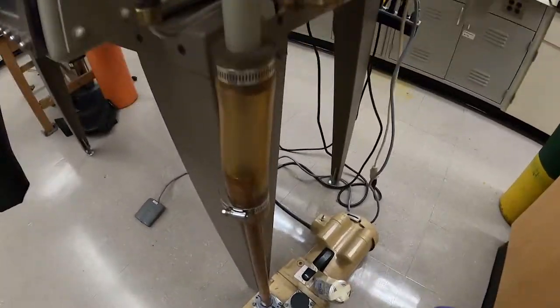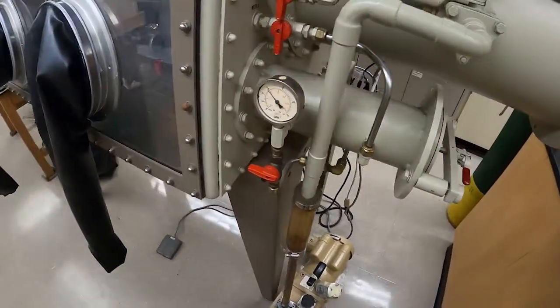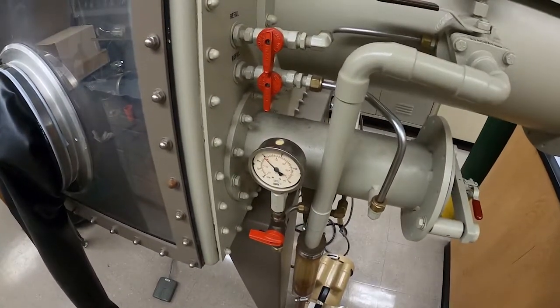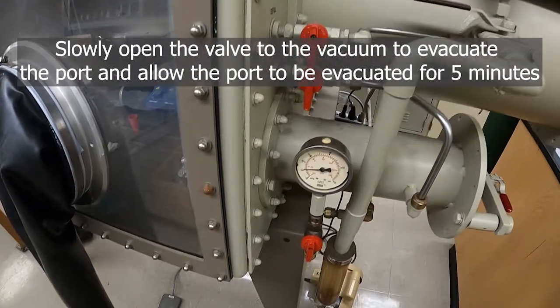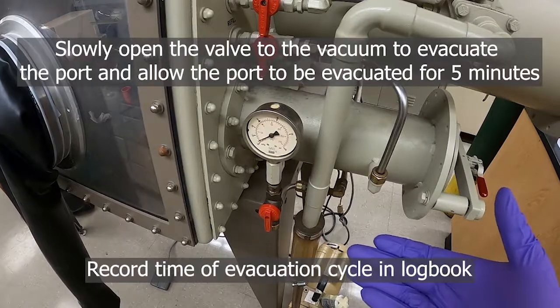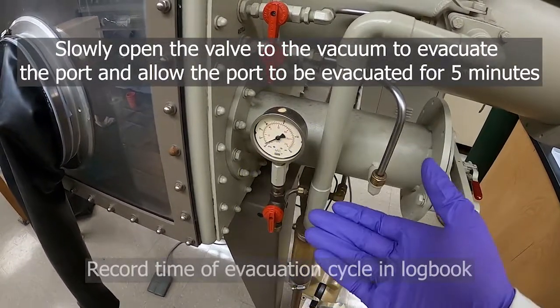At this point we want to turn on the vacuum — this should really be on already. This is just going to be loud and harder to hear. Now that we have something in there, we can do our evacuation. We would want to record the time that we started and then wait five minutes before we did the refill.